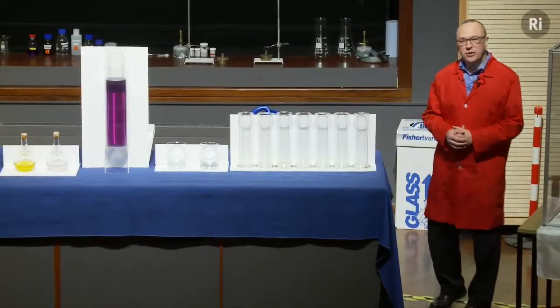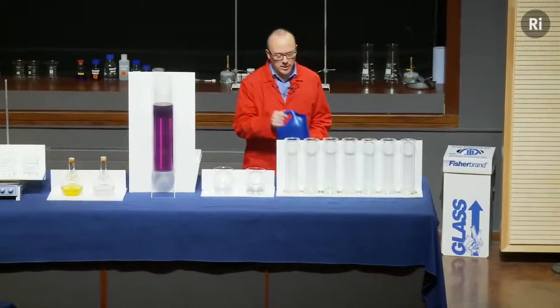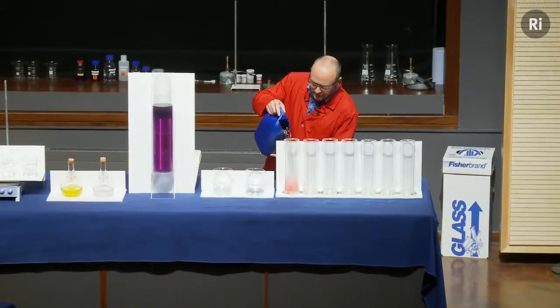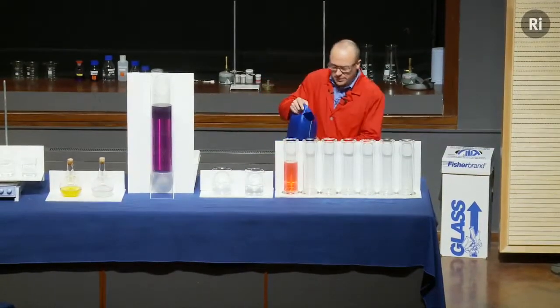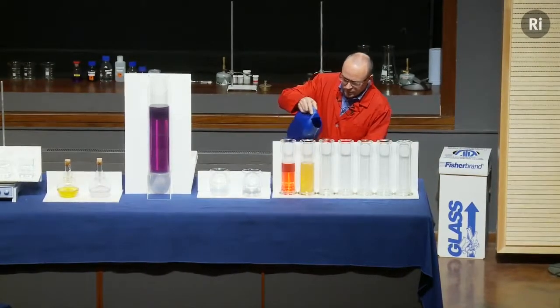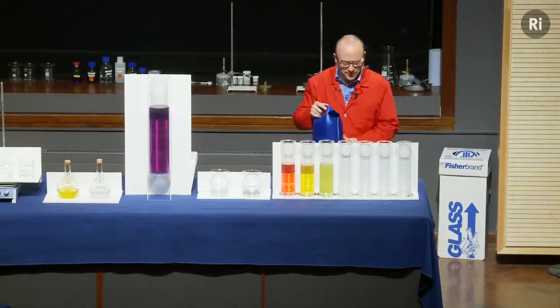Welcome to this lecture on chemical curiosities. I'm going to start with the liquid in this container, and I'll just pour some into this cylinder. So you can see it's a nice bright red colour. But let's see what happens if I keep pouring. Well, I think you can see every time I pour out the liquid, I seem to get a different colour.